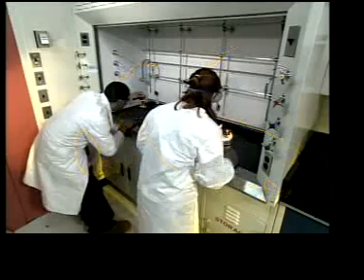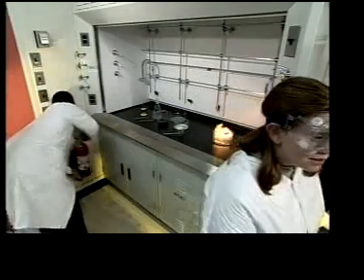Now let it run. Fire. Everybody stand back. Extinguisher.